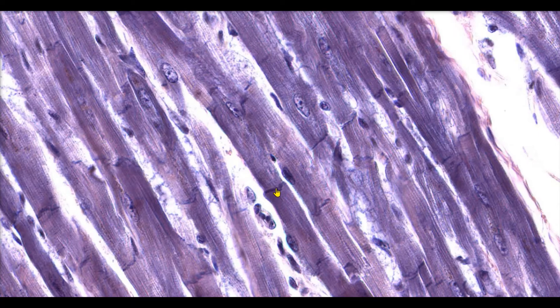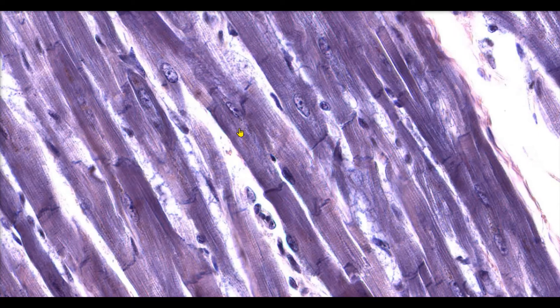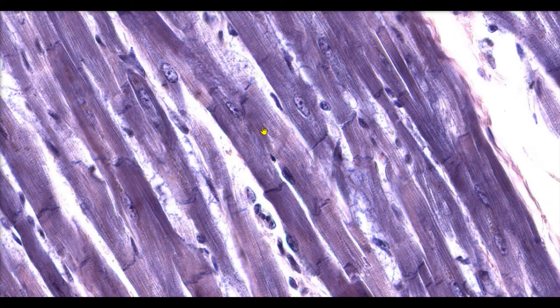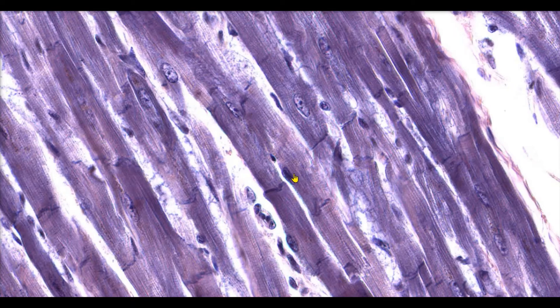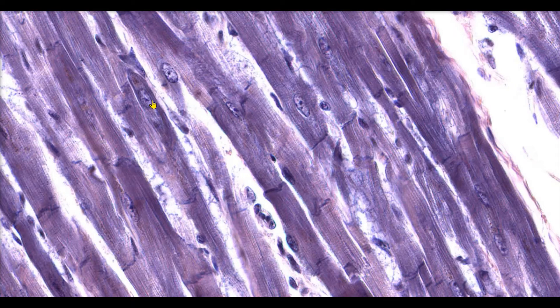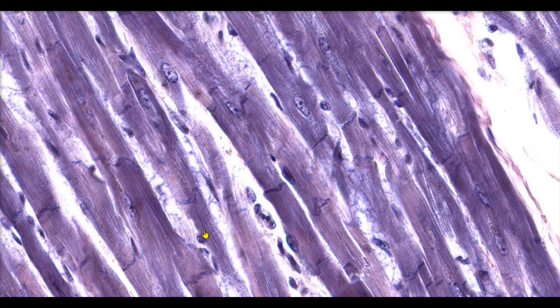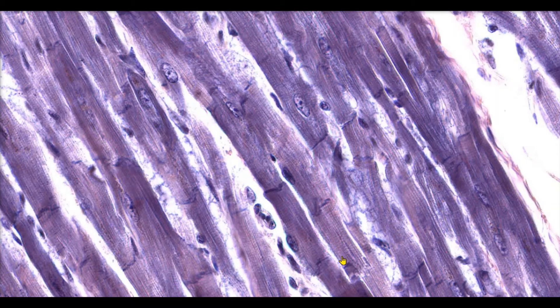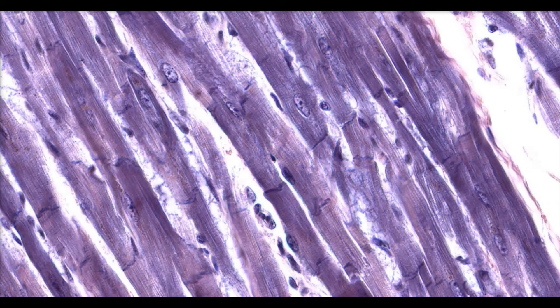We can also see that the cells of cardiac muscle are short and they're branched, so they split unlike our skeletal muscle fibers. We can also see that each cell only contains one or two nuclei. Like skeletal muscle, cardiac muscle has striations due to repeated sarcomeres — those are the little stripes that we see along the length of the cell.